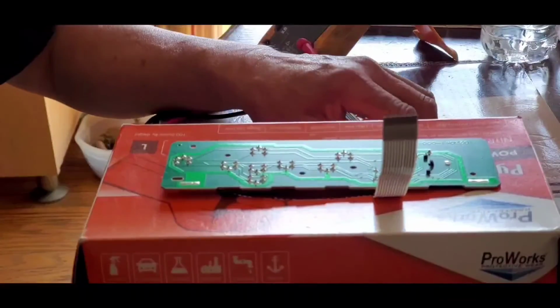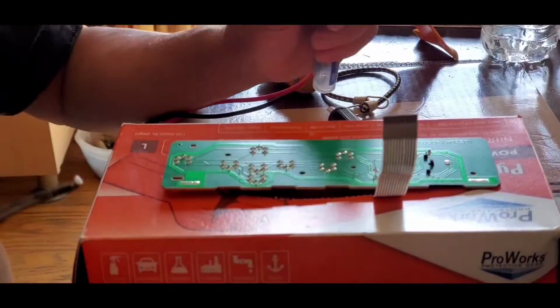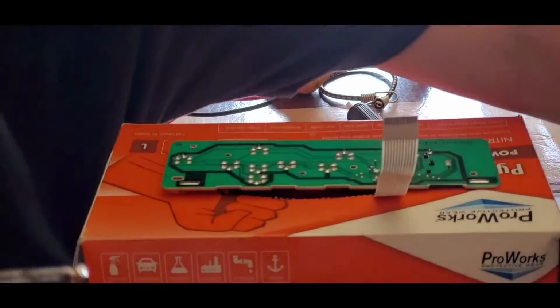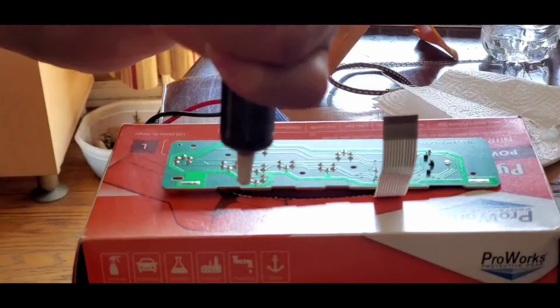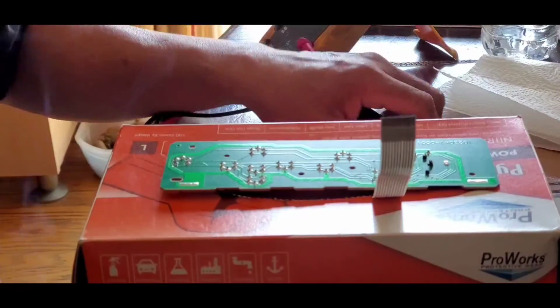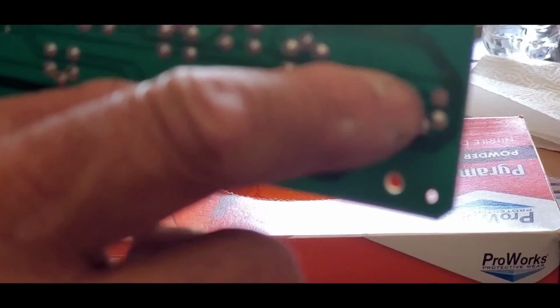This is how I'm gonna do this. First, I'm gonna heat up the tip of this. Okay, once it is hot, I'm gonna wipe the excess off the tip and then press this in, apply solder, press one here to melt the existing solder. If there's varnish in it, it's gonna take it off. Okay. Oh, there's one. I don't know if you can see it, but here, oops, it's hard to see. Okay, right there.